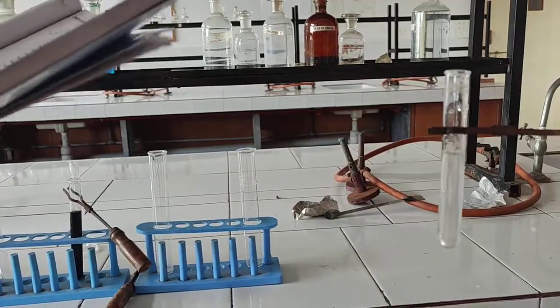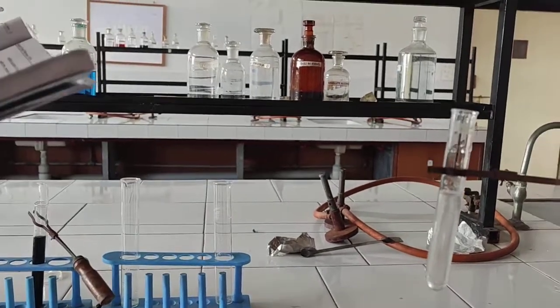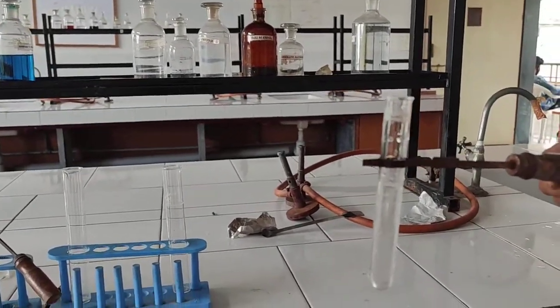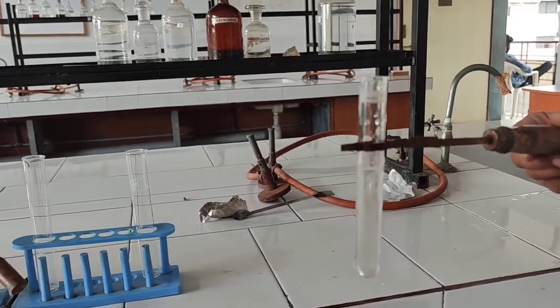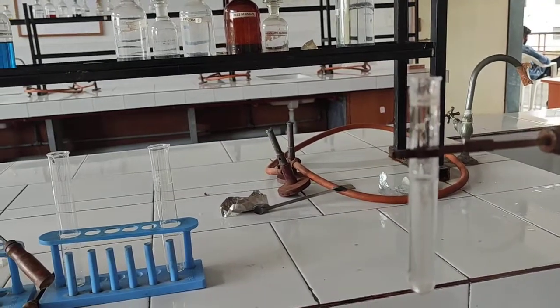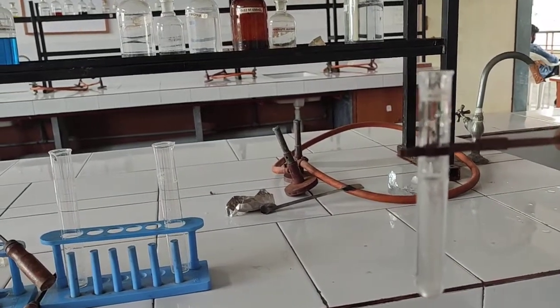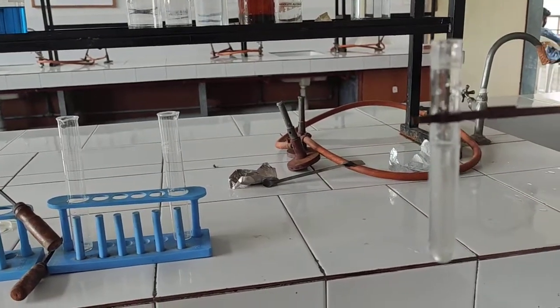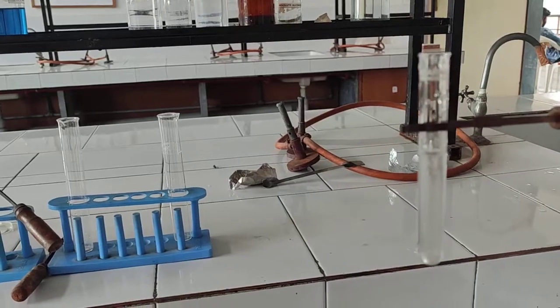This is the sulphate test. We take 10 ml of water for injection, then add 0.1 ml of 2 molar hydrochloric acid, followed by 0.1 ml of barium chloride solution. There is no colour change after at least 1 hour. Therefore, we can say that this water for injection is suitable for injectable preparation.